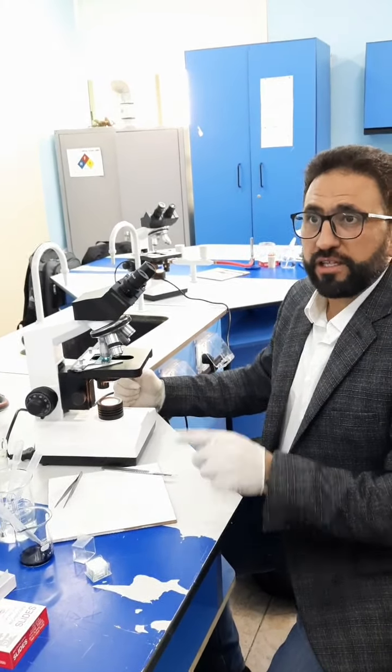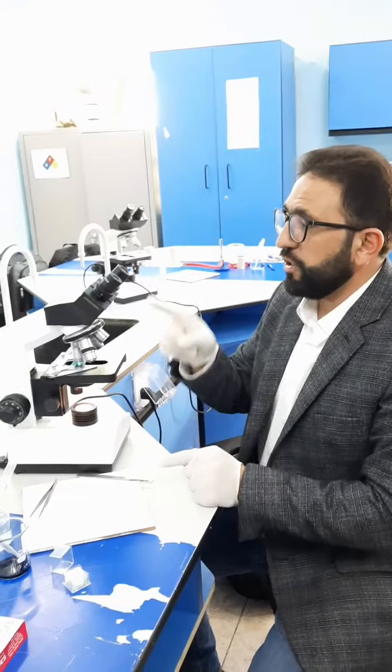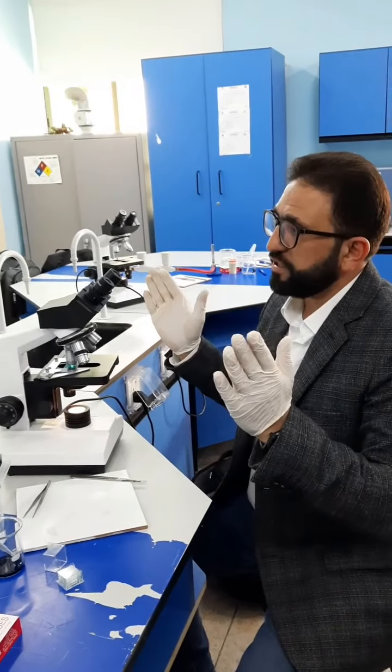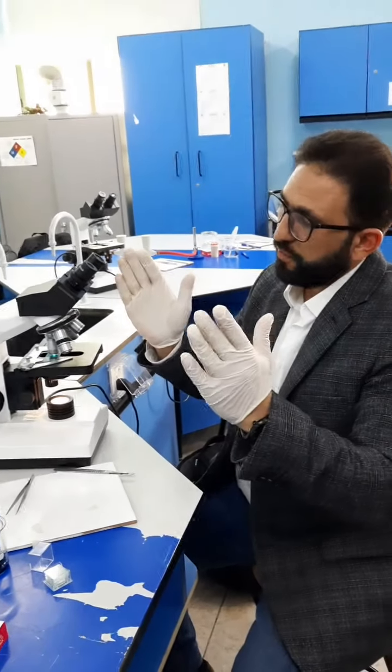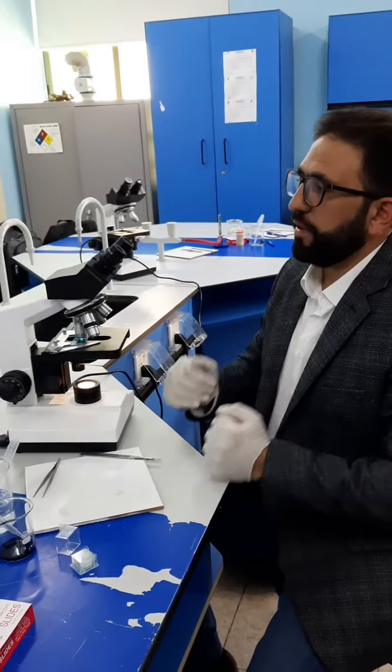Okay, guys. Now it's your turn to prepare the onion slide. And once you finish that, you need to measure the mean length of cells. That means you're going to take 5 cells, measure the length of those 5 cells, and calculate the mean of them. Okay? Thank you.